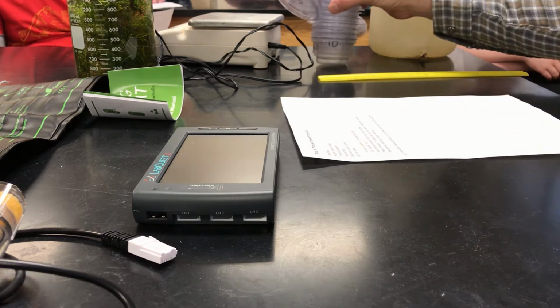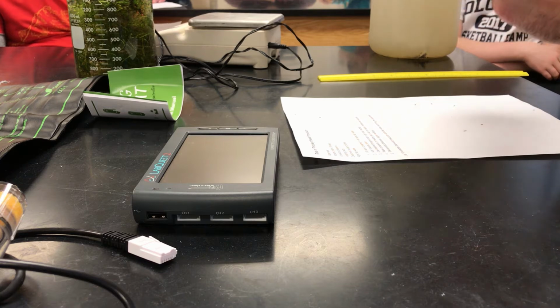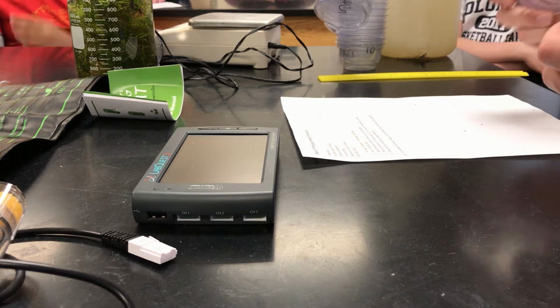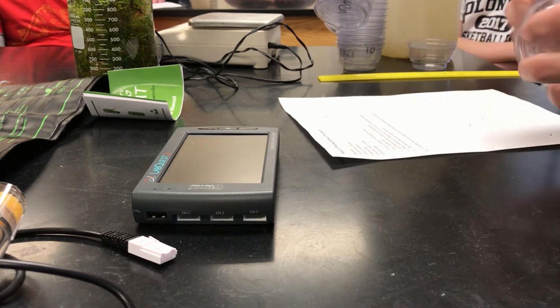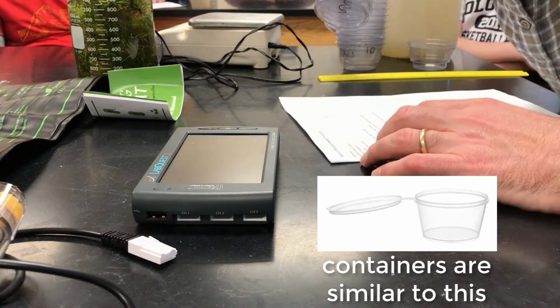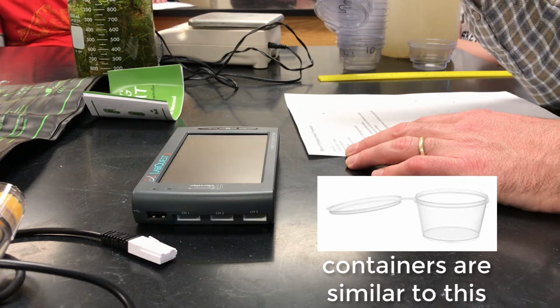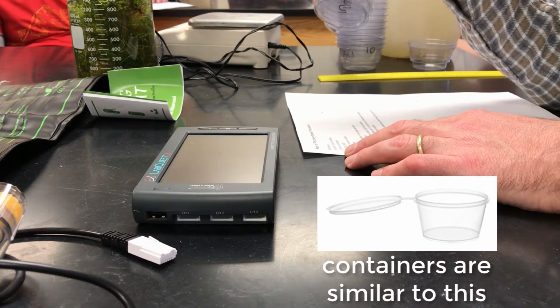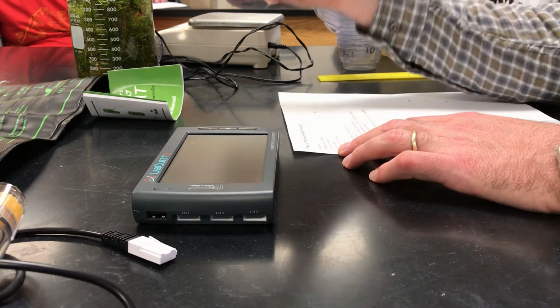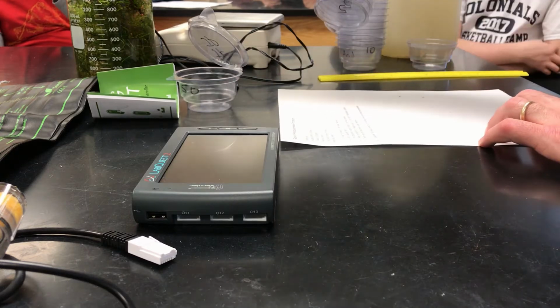So you're going to do something very simple. You are going to get some closed containers. These are the kinds of closed containers, and I have a giant box of these down in 254. You're going to basically get, well, that one's not very good because it doesn't close, but you're going to get lids like this, and you're going to get 12 of these closed containers. And 6 of them you are going to make your control, and 6 of them you are going to make your test.